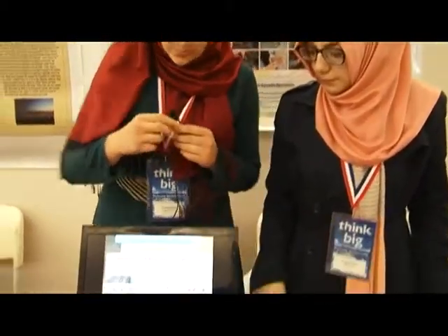Welcome. My name is Gushra. My name is Jilal Cesar. We are coming from Nilpere Girls' College. Our project is about isolation of pathogenic bacteria from public computers.